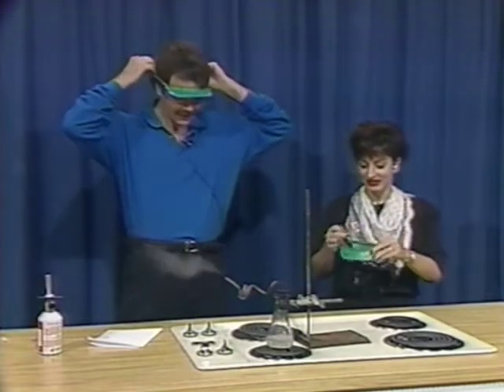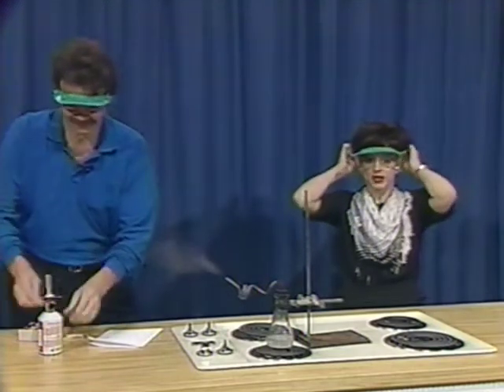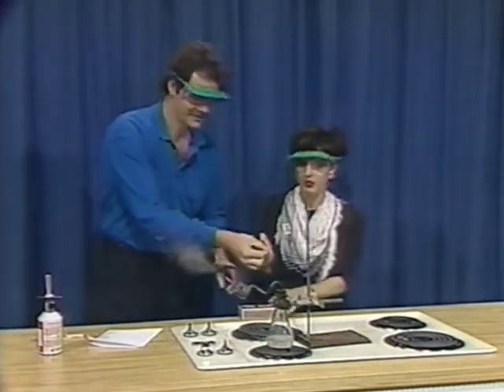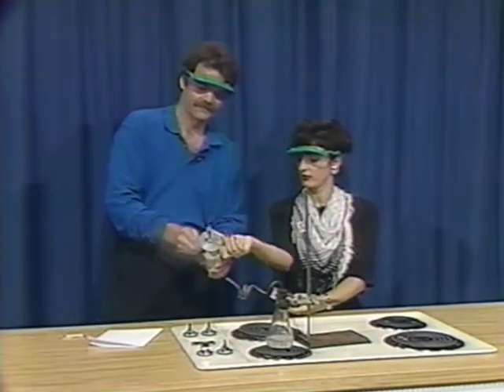Goggle time. They look good on you, too. Oh, do they? You're so kind. He's just trying to be nice. And so if you'll strike that match, I'll get you to light this burner for me. There we go.